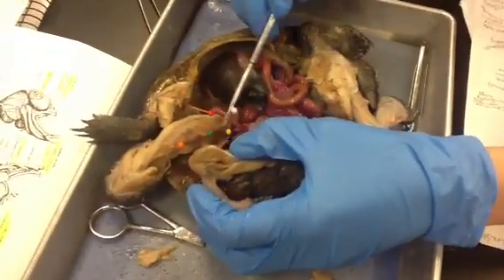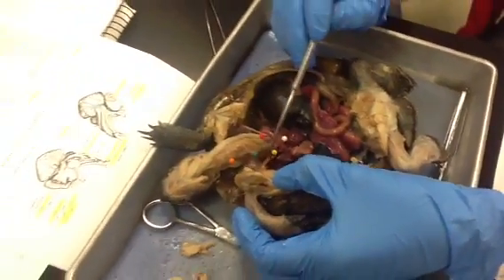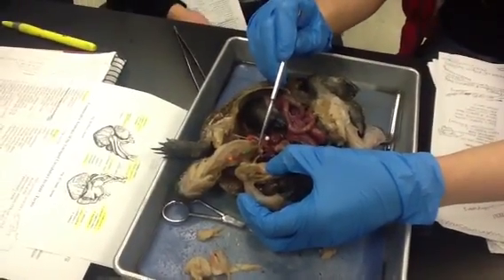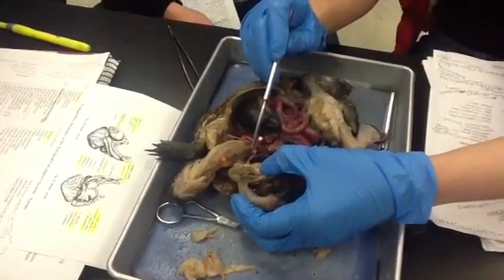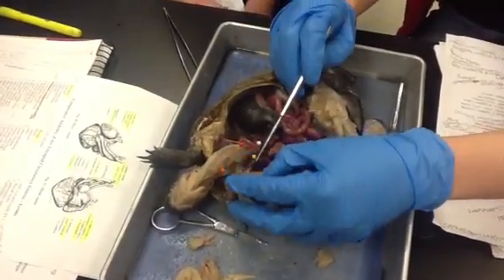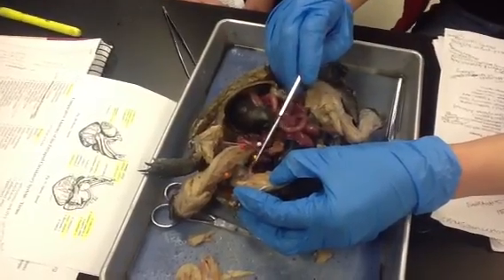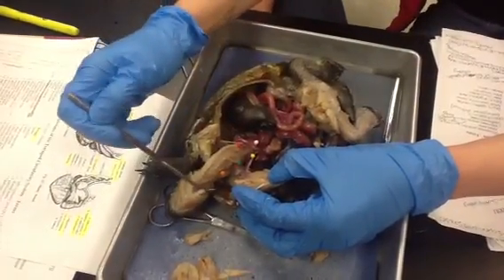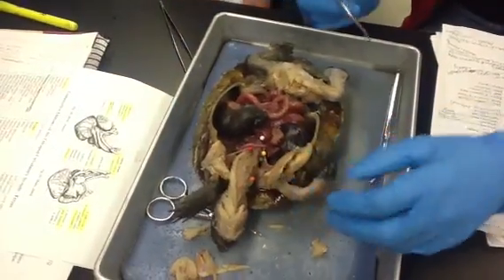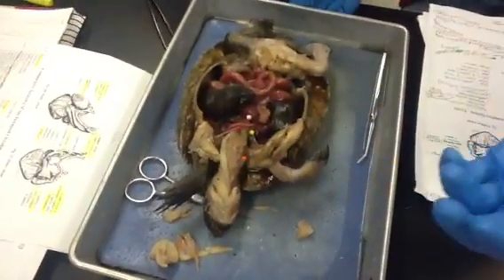So on this — did you guys see that when this one comes up, it goes to the subclavian arteries. And then coming off of this also, posterior to it, it comes off into the carotid. So you guys might want to look at the branch here, but I think we covered everything.